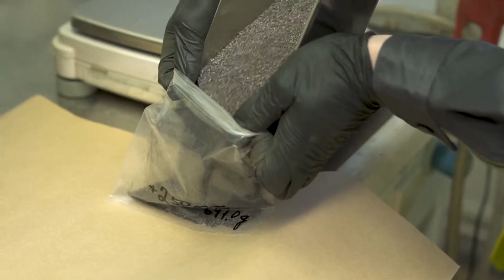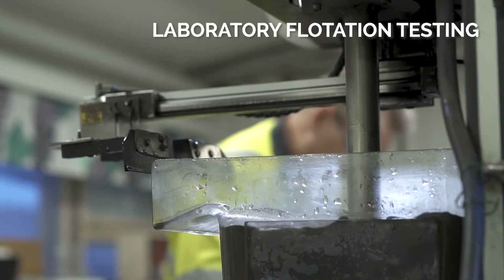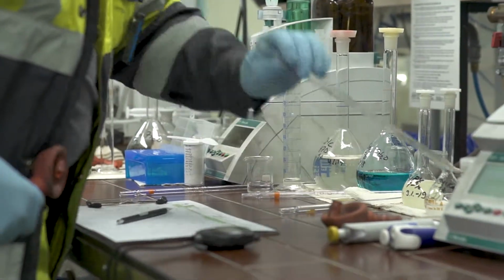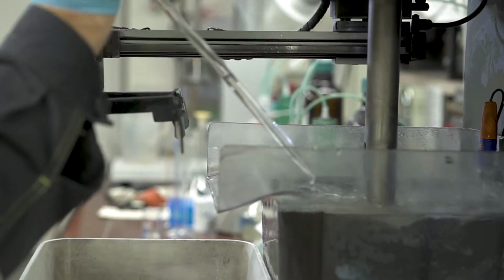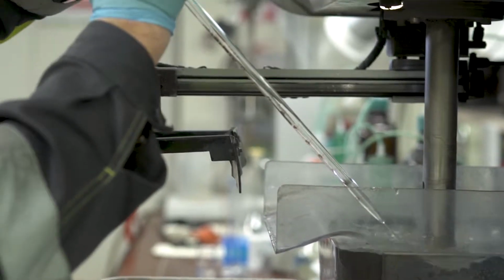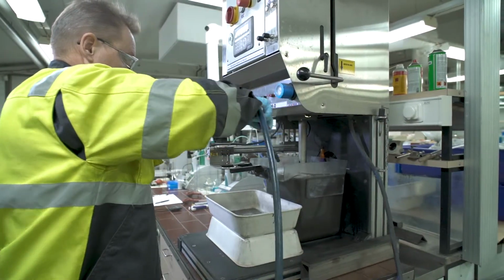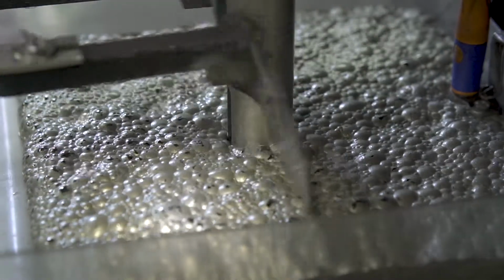For designing the continuous pilot plant process, batch test work in laboratory scale is the first step to validate the process and preliminarily determine technical parameters. In flotation test work, grinding size, reagent type and dosage, slurry pH and density, and flotation time, etc. are important parameters to be tested.